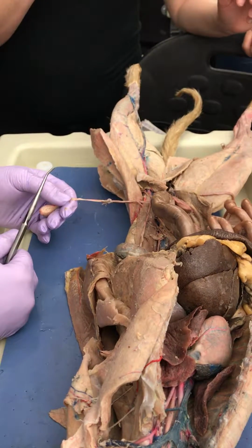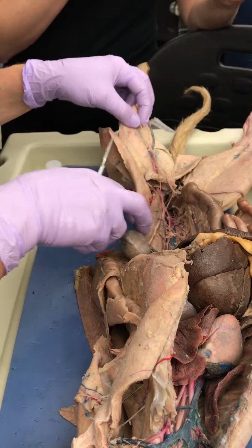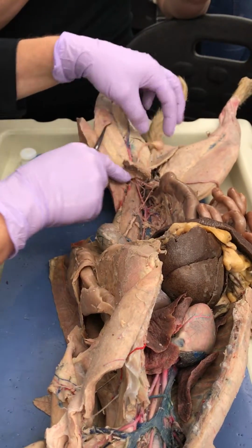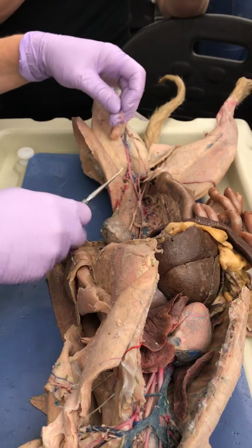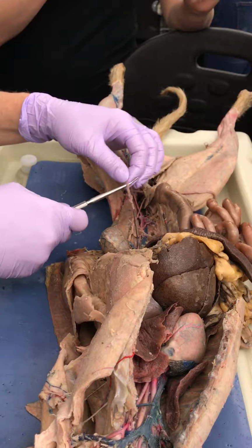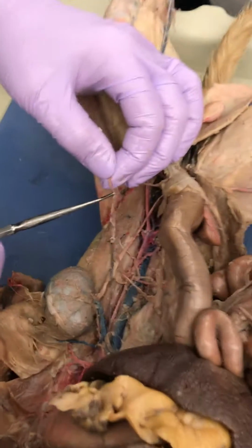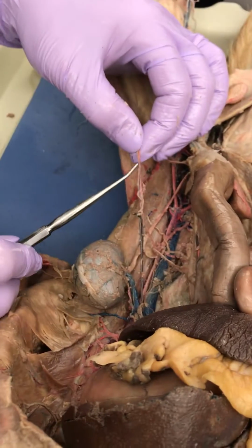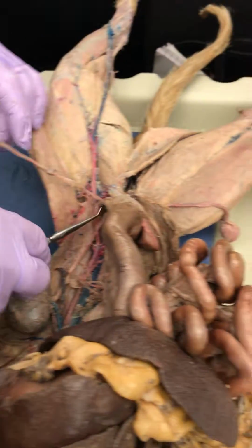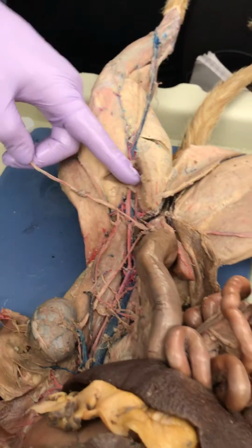You guys okay with that? Five parts of spermatic cord. So look how cool your cat is, because this came through his abdominal wall, kind of like that. And you're so good, you still have his testicular artery intact. You really still have his testicular vein intact too. It just didn't get any latex in it. And then you still have your vas deferens intact right there.